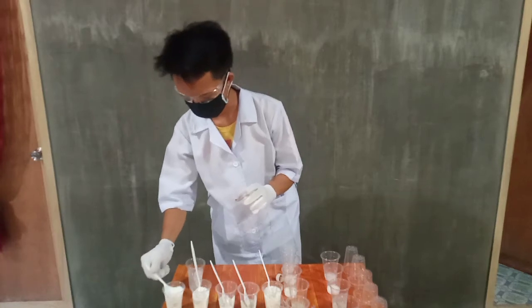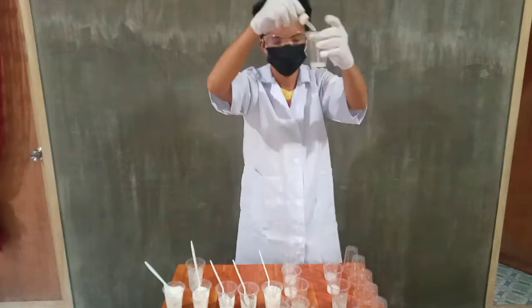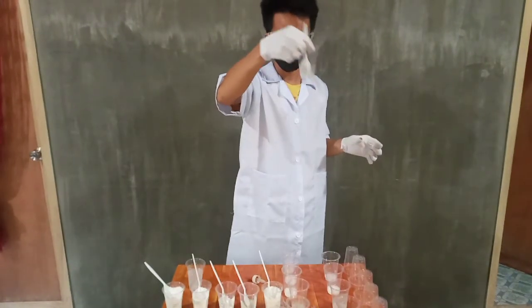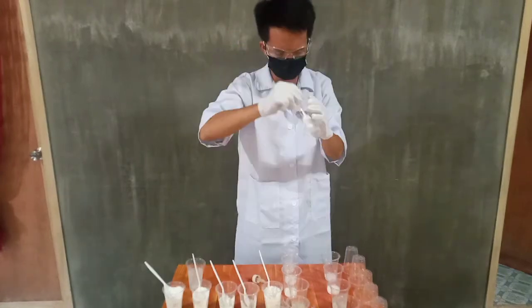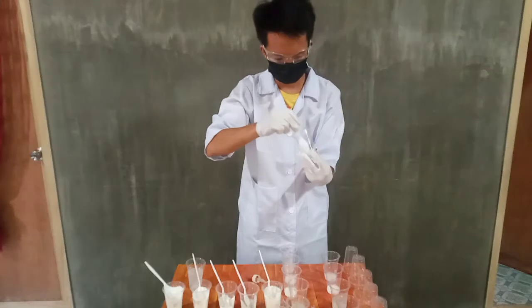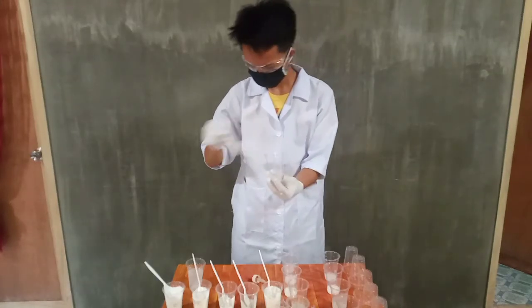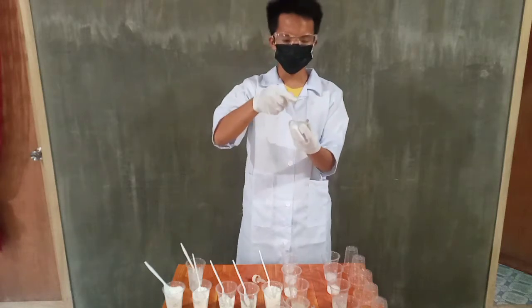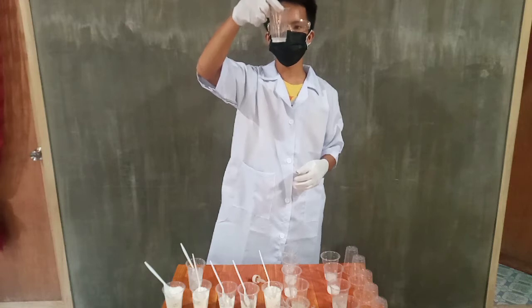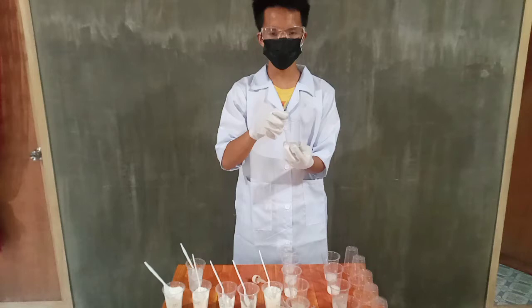Let's watch this. In this mixture, salt and vinegar, there's no reaction, but salt can dissolve in the vinegar, but it will take a long time.